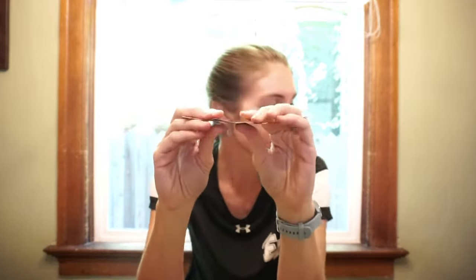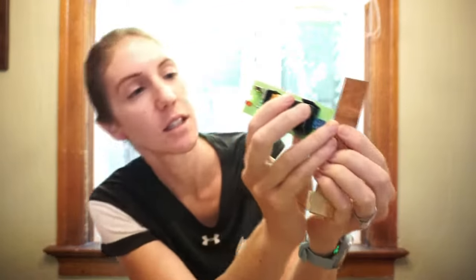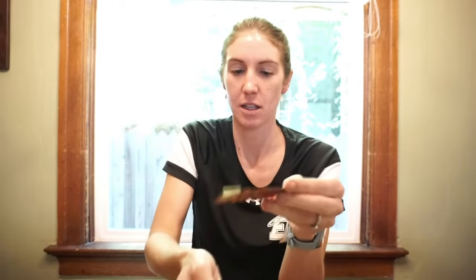Okay. Next up, we have the element Cu. That's capital C, lowercase u, right here. So first, what do you think? Shiny or dull? Next, can we bend it, or is it brittle? Then, what do we think? Does it conduct electricity? And finally, is this magnetic?